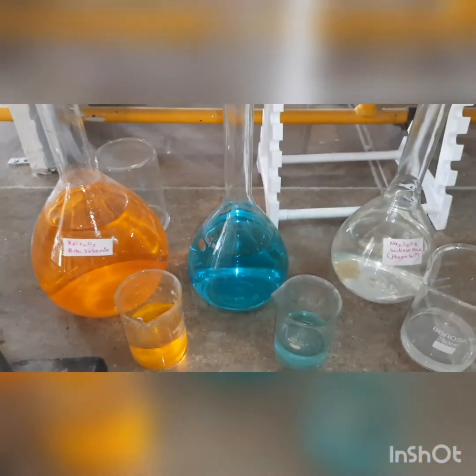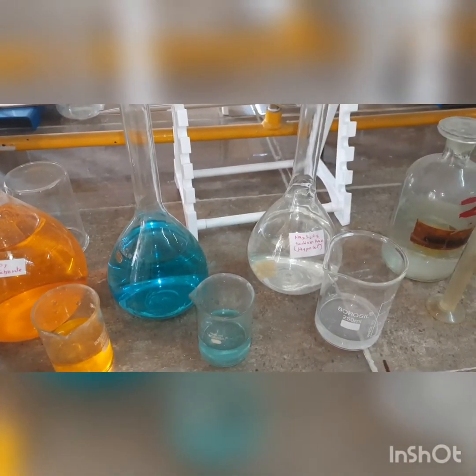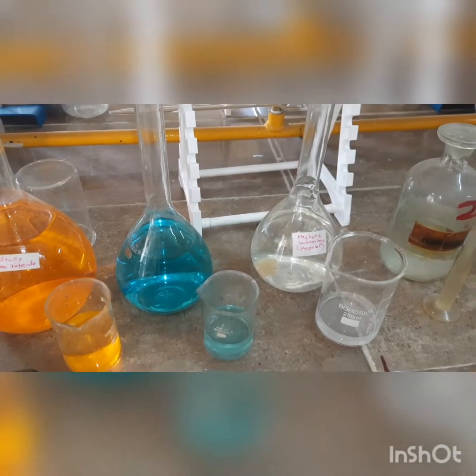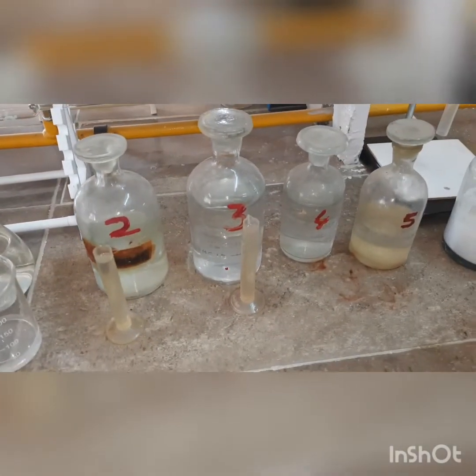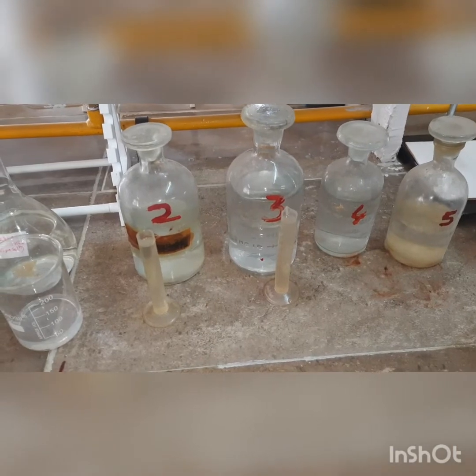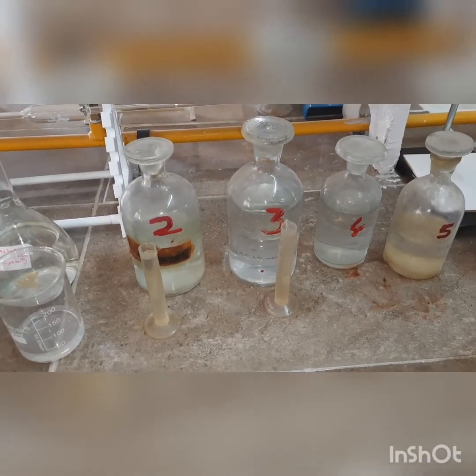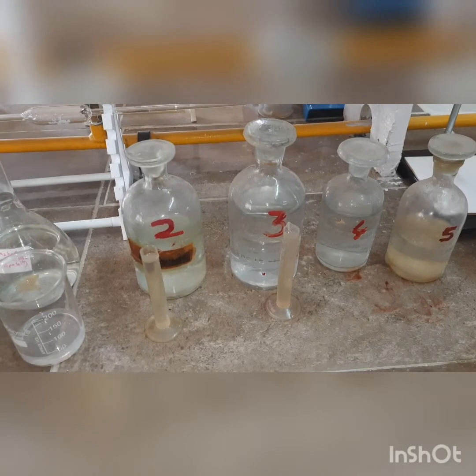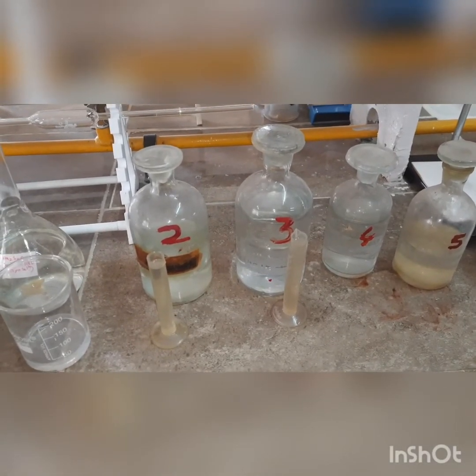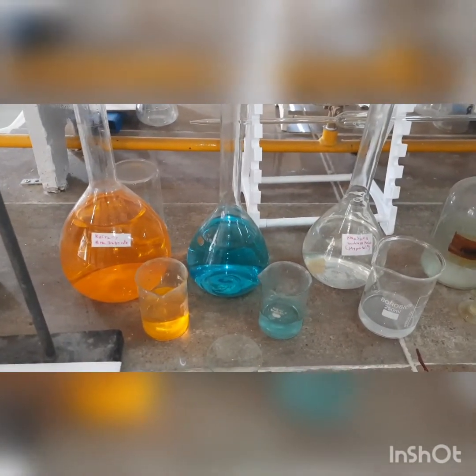In iodometric titrations, a neutral or an acidic solution of oxidizing agent is employed. That is the reason we are going to add some amount of sulfuric acid. The amount of iodine liberated is equivalent to the quantity of the oxidizing agent present — we will see this in the calculations.